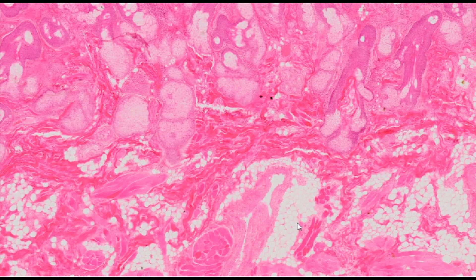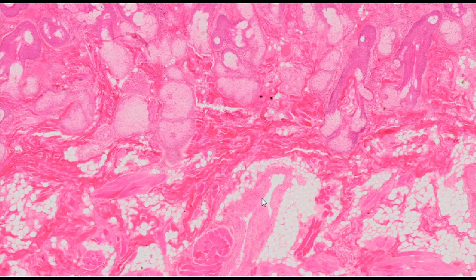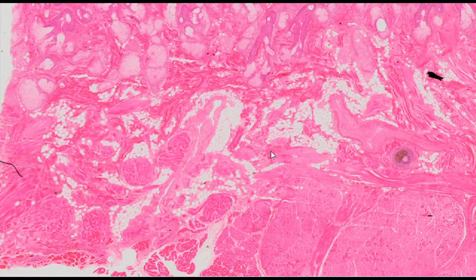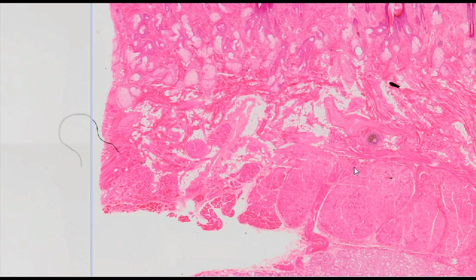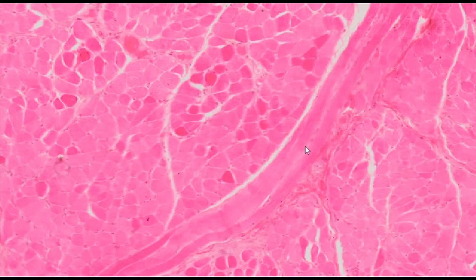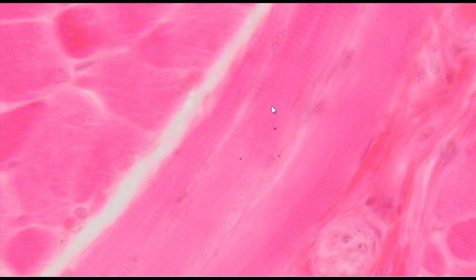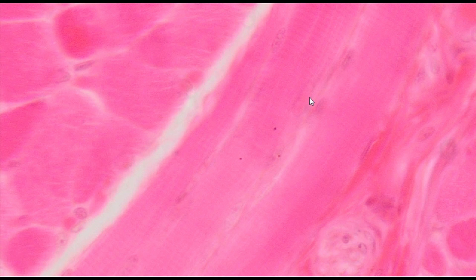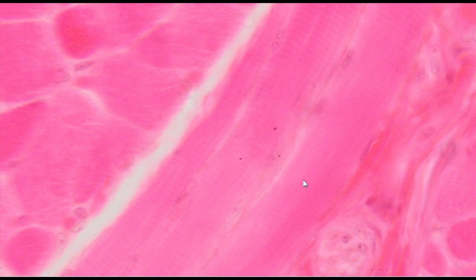The middle part of the lip is occupied by the orbicularis oris muscle, which is a skeletal striated muscle. Under high magnification, isotropic and anisotropic bands of muscle fibers as well as peripherally located cell nuclei are visible.